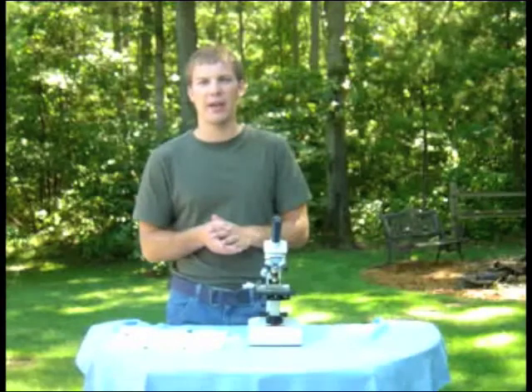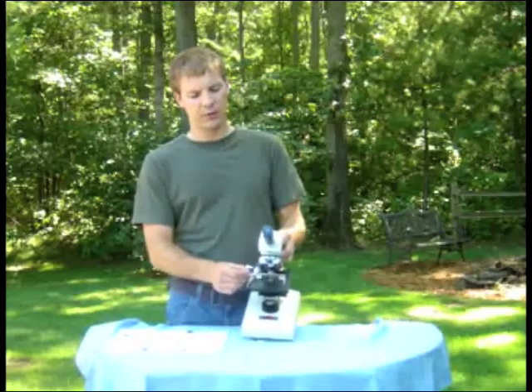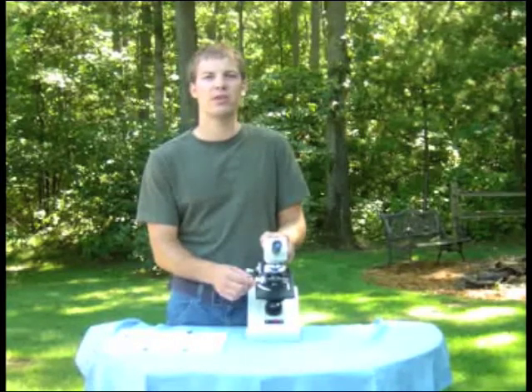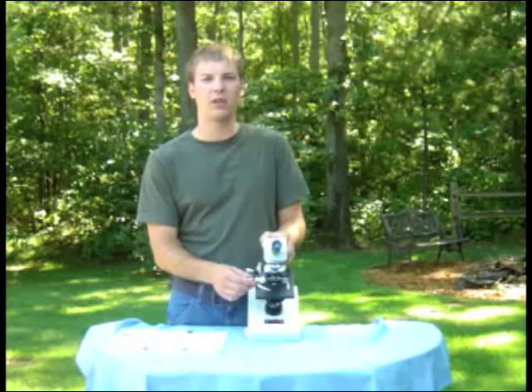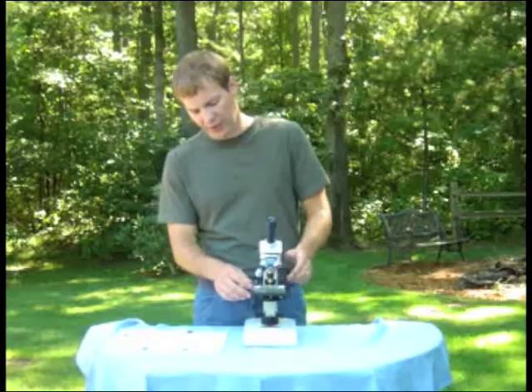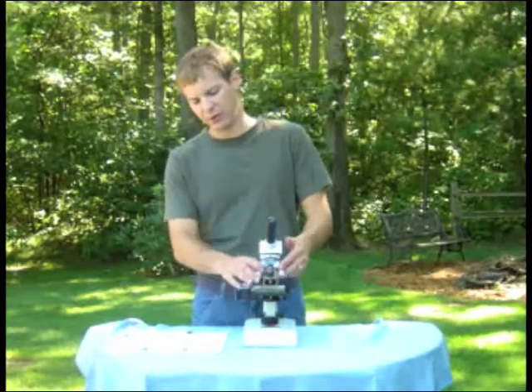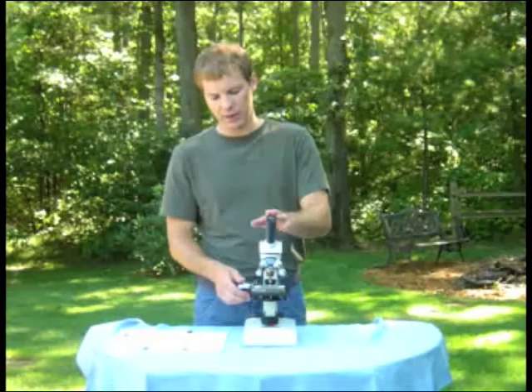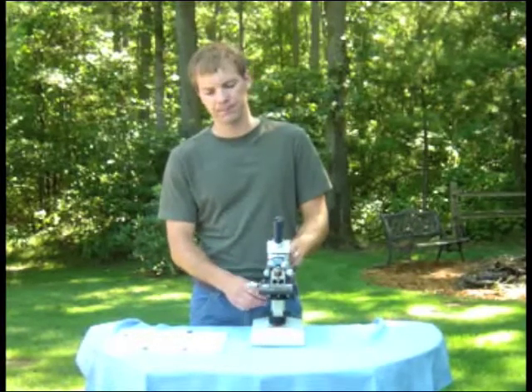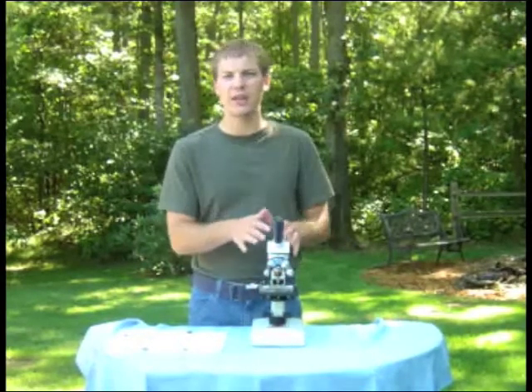Next, you'll get your slide — whatever I give you — and lift the arm up right here and put your slide onto the stage. Please be very careful with this arm, as it is a built-in slide catapult. We have broken several slides by students letting go of the arm too quickly and flinging them off the table. After you've got your slide on the stage, make sure the low power objective lens is in place. Start with the smallest one, look through the eyepiece, and use the large coarse adjustment knob to bring your slide into focus. Then use the mechanical stage to scan around the slide to find something of interest.